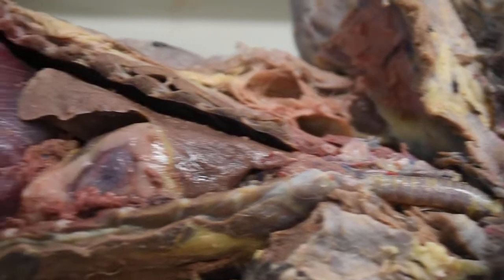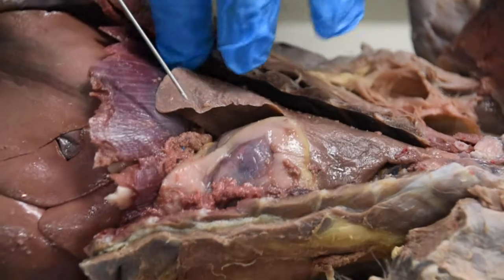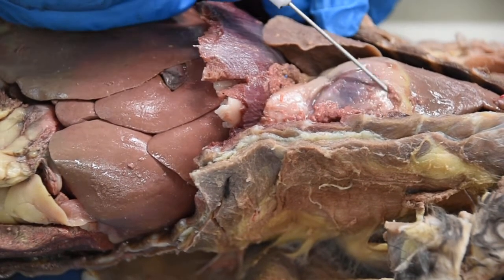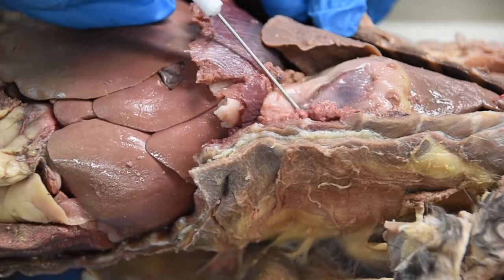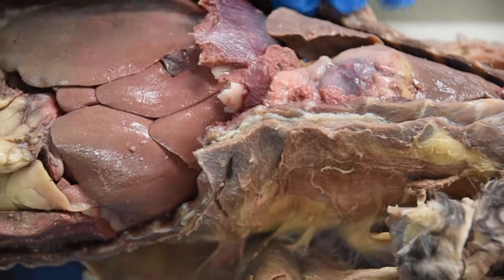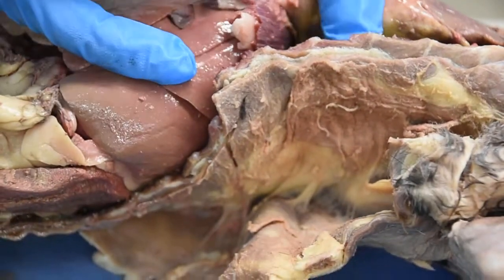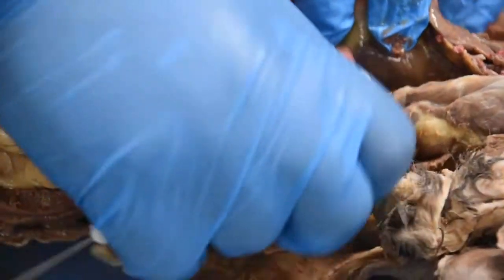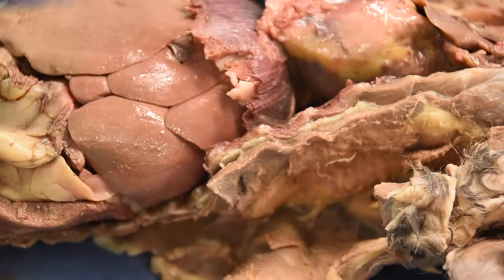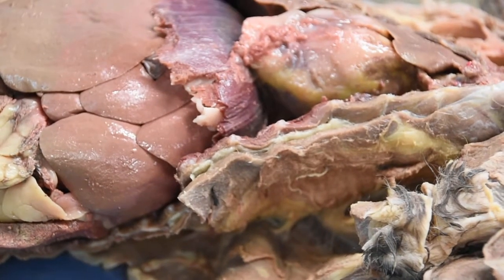Now moving up, we have your thymus gland right here, and right below that you can see the heart and lungs. So here is the heart right here in its pericardium, the double membrane that protects it. On either side, these ones right here would be the lobes of your lungs. This side would be your left lung, and these lobes right here belong to your right lung.